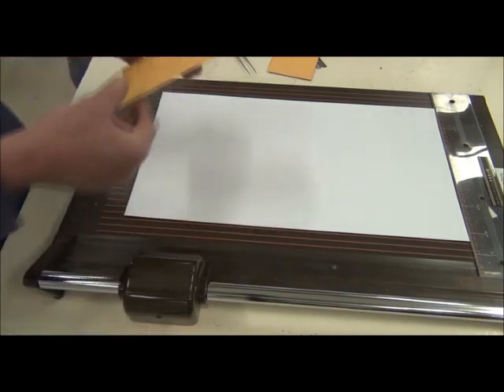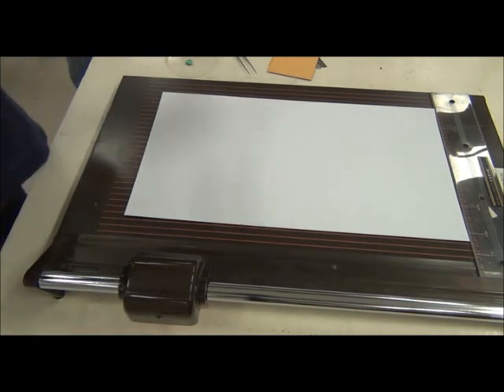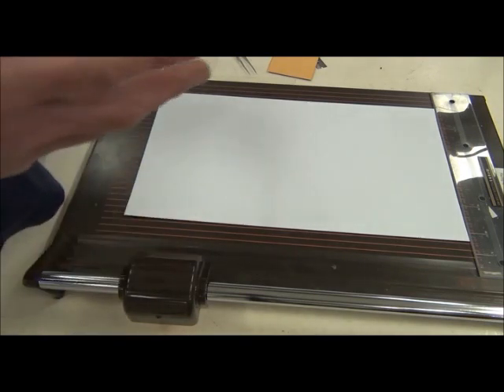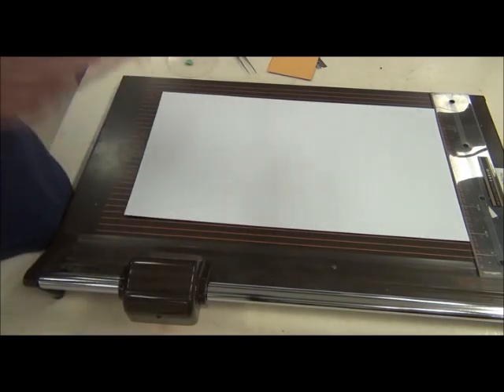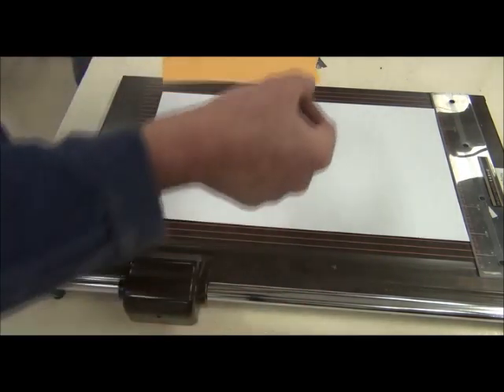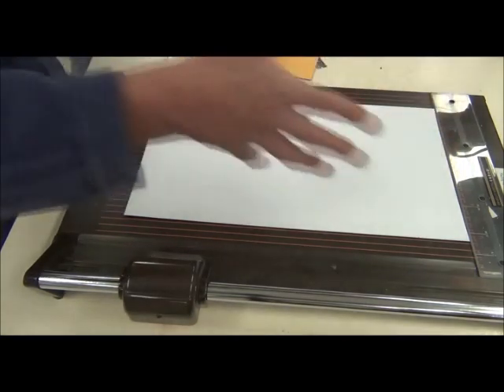What sort of glue? Well the glue sticks, the blue stick, the yellow sticks that you buy for one and a half dollars or something from Kmart or Big W or news agents are just fine. In fact they're much less messy than using wood glue which would be the other thing that's okay. But I'd suggest that when you're putting the glue on you just do it on a separate piece of newspaper so it's out of the way and you're keeping your work space clean.